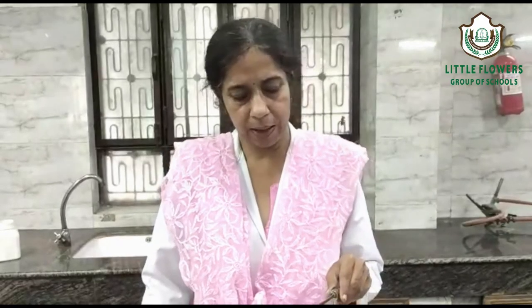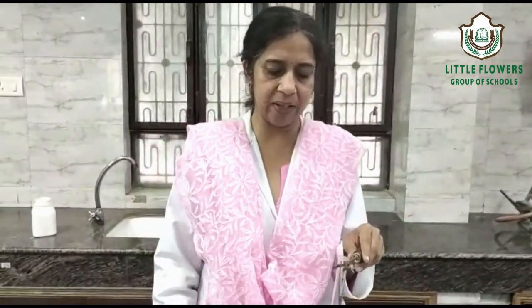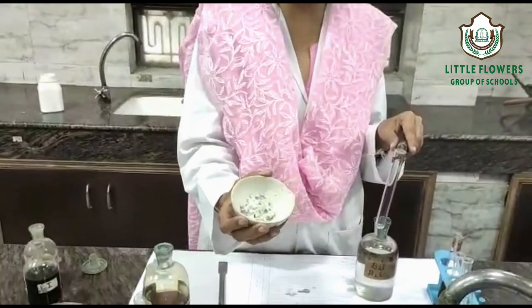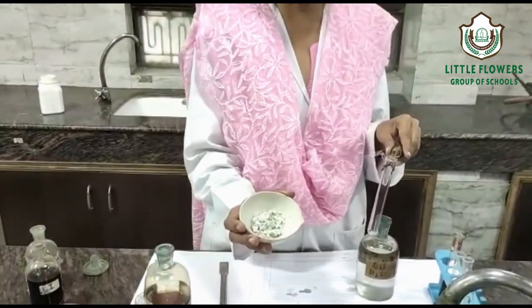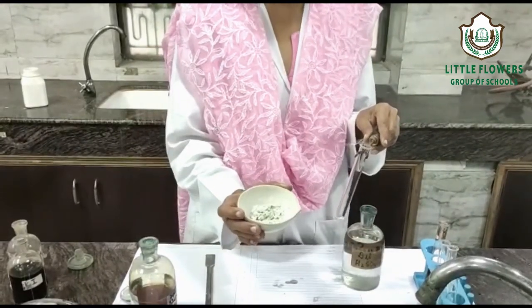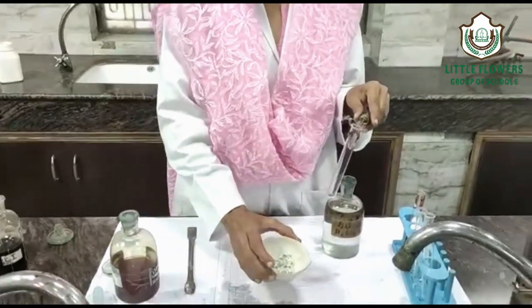This is another experiment. The aim is to analyze the given salt for acidic radicals. Physical observation: the colour shows it is a flaky salt, but some moisture content is there, so it looks non-flaky and has a slight dull white appearance.